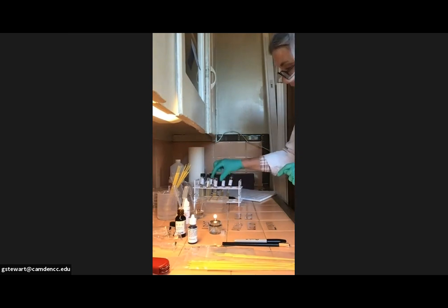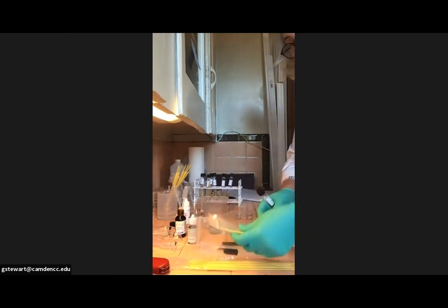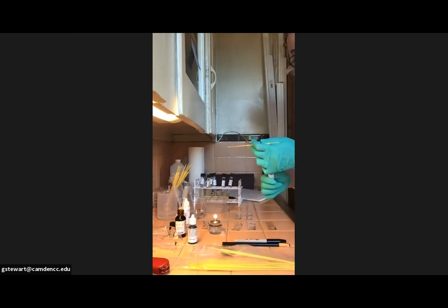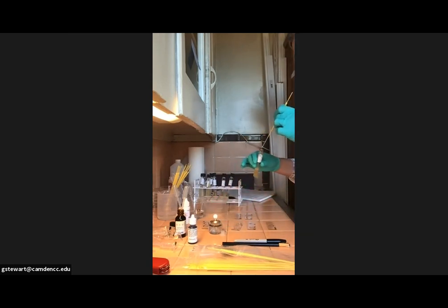And I put the Serratia on my slides. Slide 1, my second slide 1A position, and my second slide 2A position. So again, I'm only going to have to use 1 loop. And I will go to the whiteboard while these are drying and put the order that I put my bacteria on for you so you guys can see.